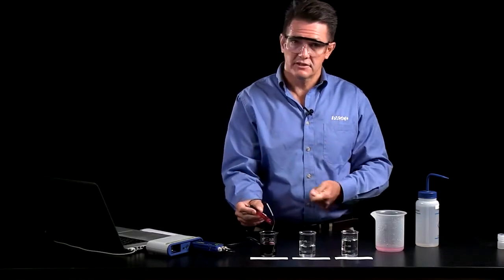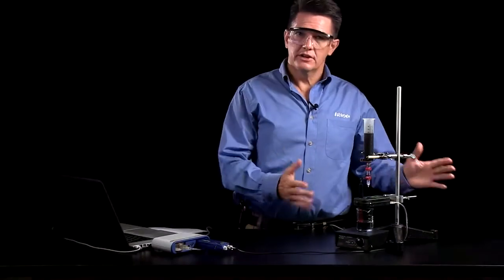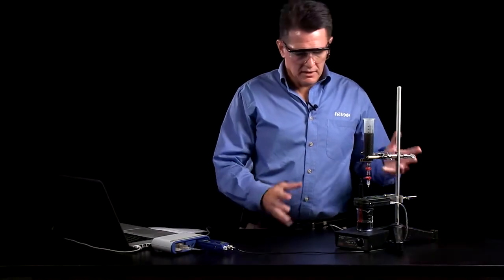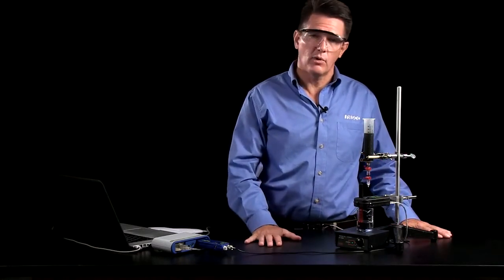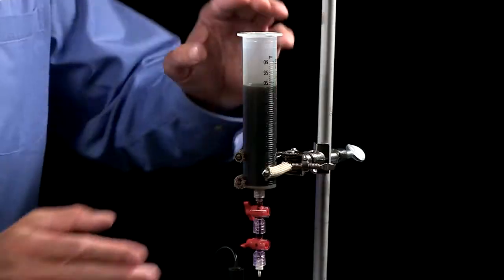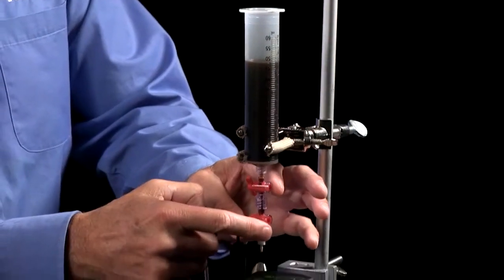Here's our titration setup. The actual concentrations in the process is described in our Advanced Inquiry Chemistry Manual. It involves a syringe with the iodine in it, two stop cocks.